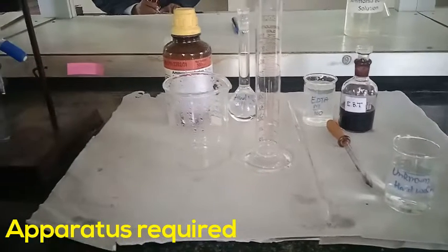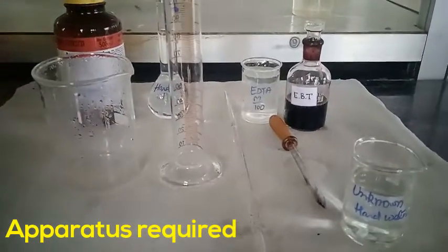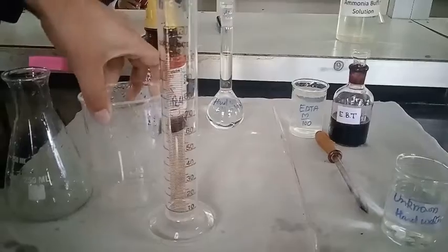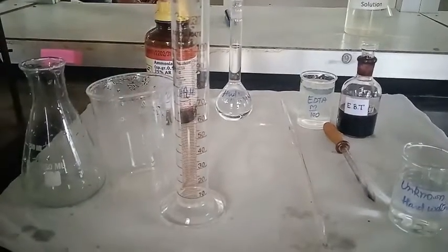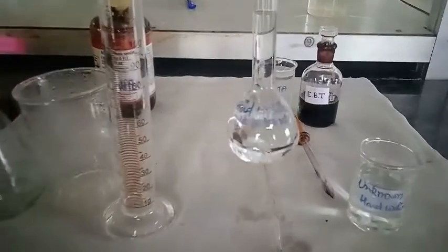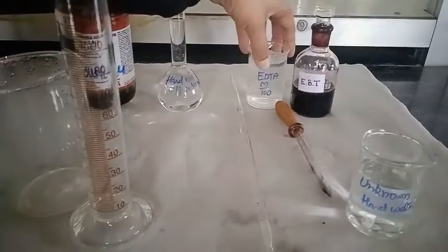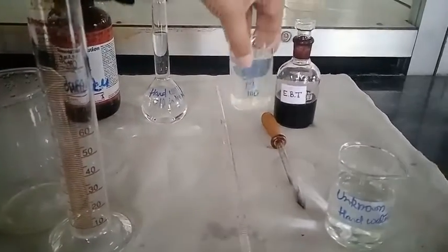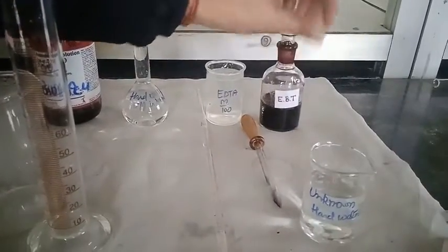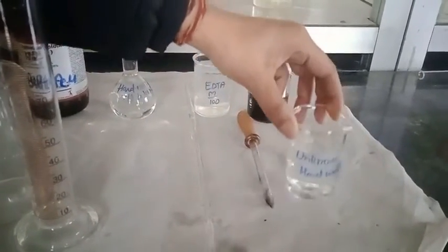In this experiment the apparatus required are: conical flask, beaker, measuring cylinder, hard water, EDTA M/100, EBT as an indicator, dropper, and unknown hard water.